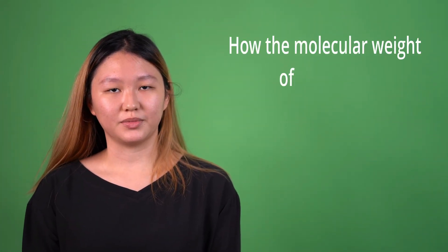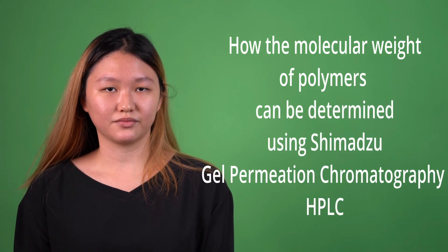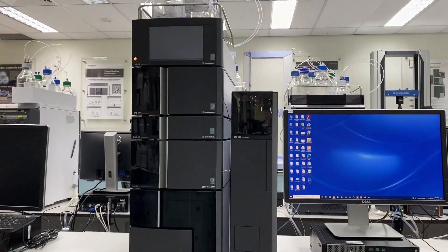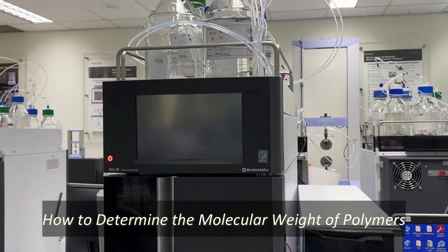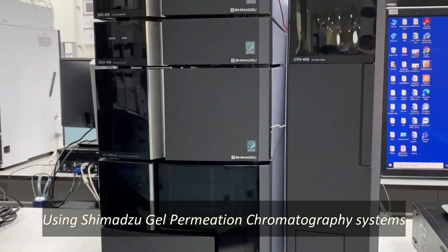This video will demonstrate how the molecular weight of polymers can be determined using the Shimadzu gel permeation chromatography systems.